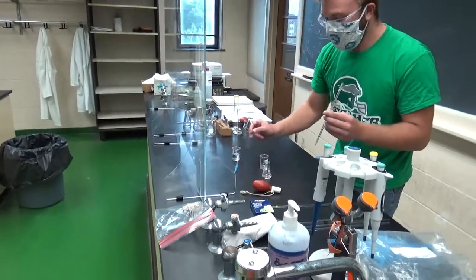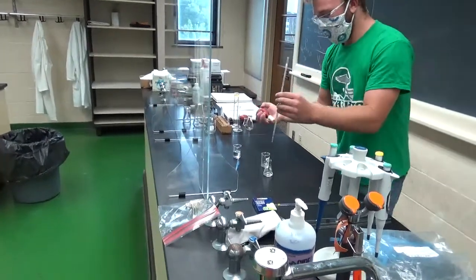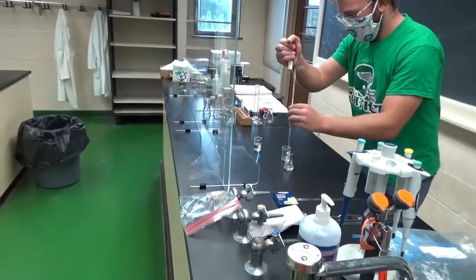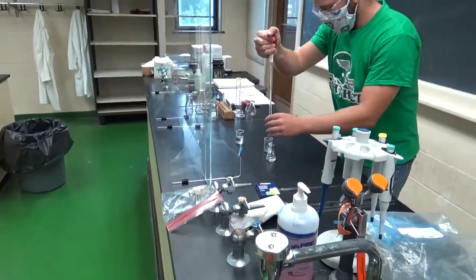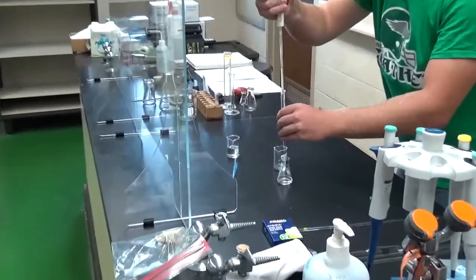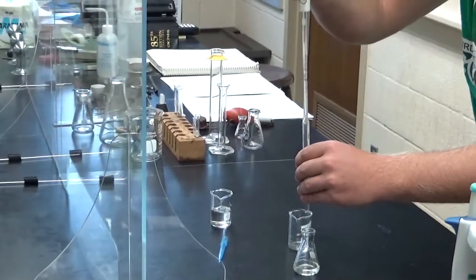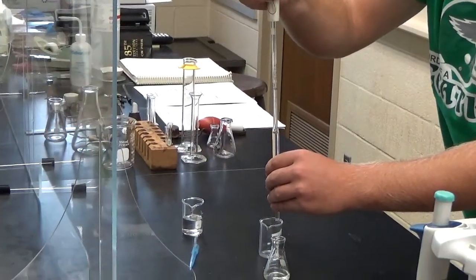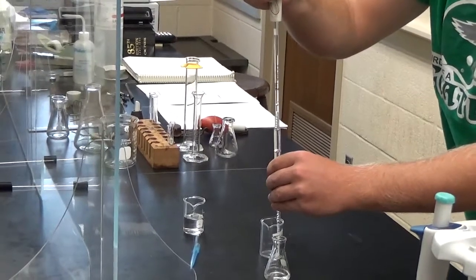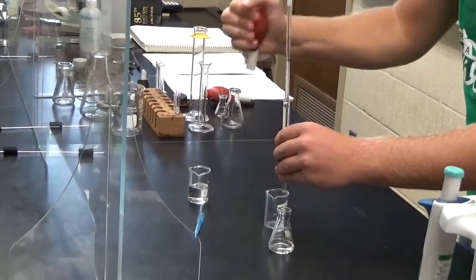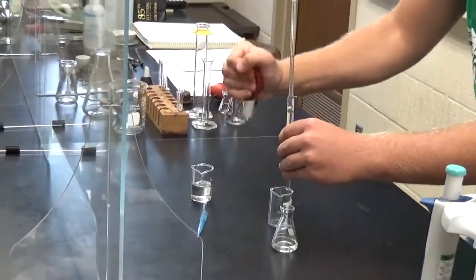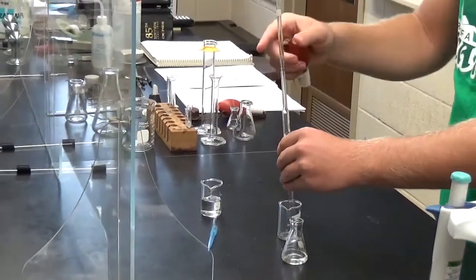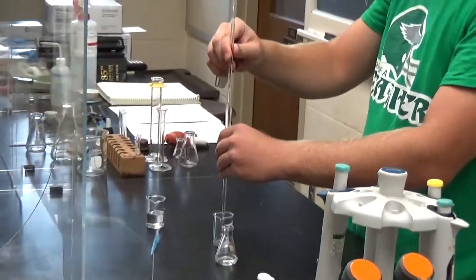Air bubbles sometimes get into these pipettes if there's not enough liquid, and you have to tap those air bubbles out. It's kind of hard to show that, but we'll see. You could get water that splashes up through the pipette, up to the top sometimes, and it goes up into the bulb. There, that's perfect. See that?